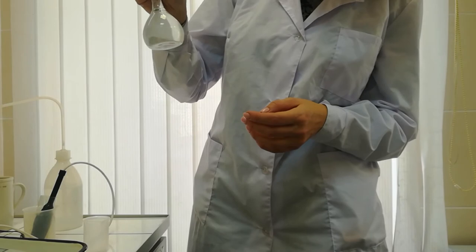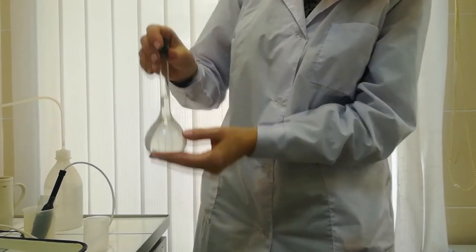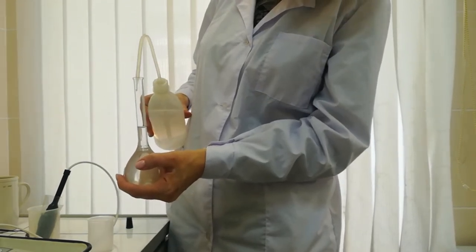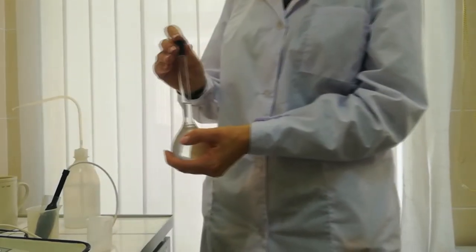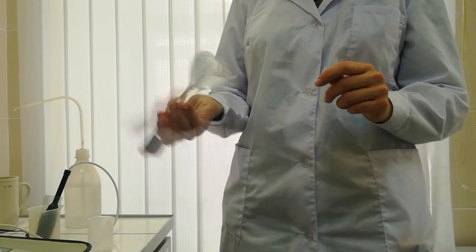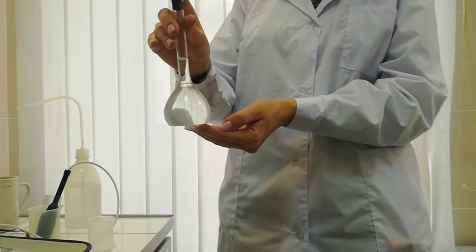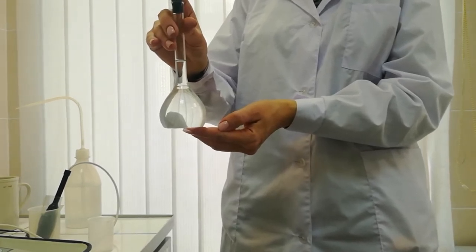We mix the solution until all the salt is dissolved and the solution becomes transparent. A little more water is added if needed, and we mix again. This is our solution with mass fraction five percent.